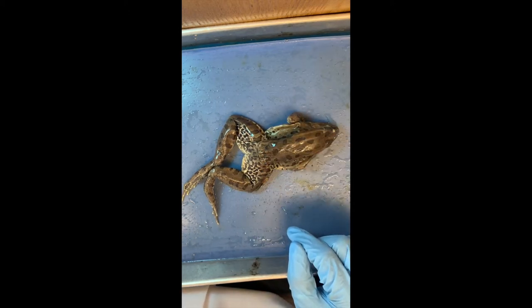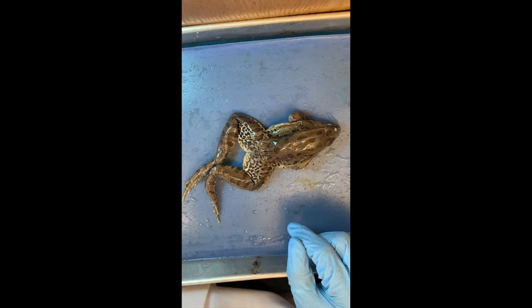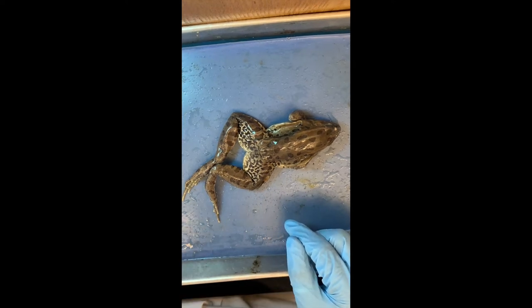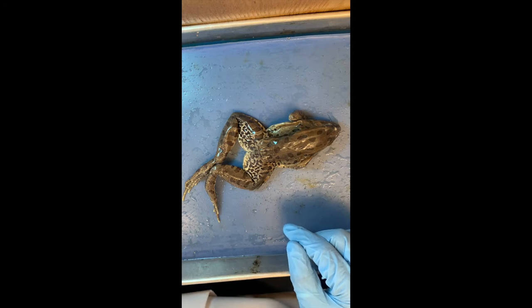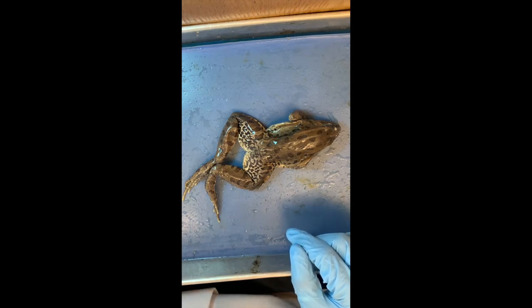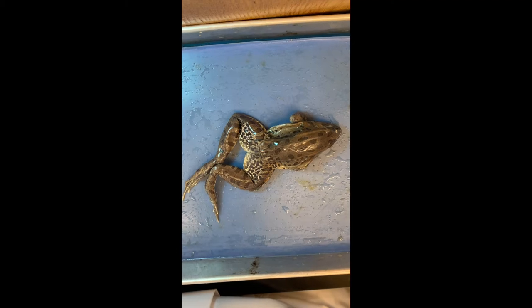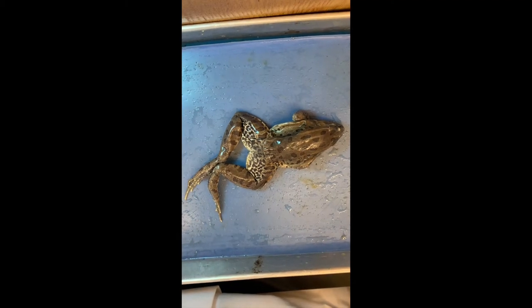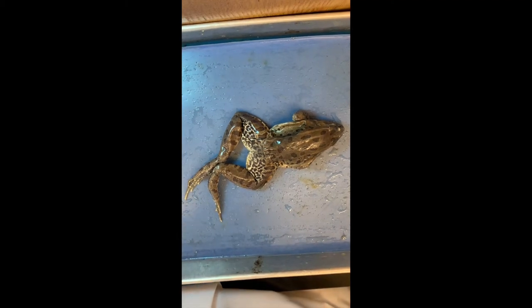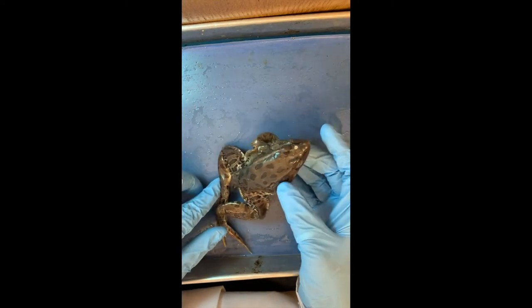If you wanted to eat this as is right now, could you? No, because it's in formaldehyde. Oh, that's why it stinks so bad. It smells really bad, and you should be happy you don't have to smell this right now because it's terrible. But we do it for the love of science — and the love of frogs.